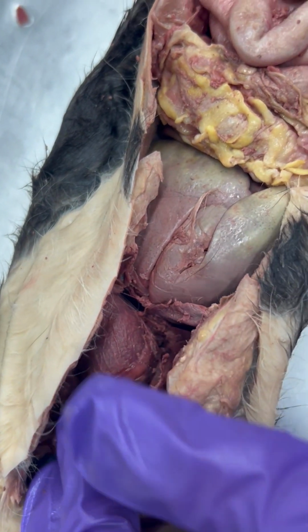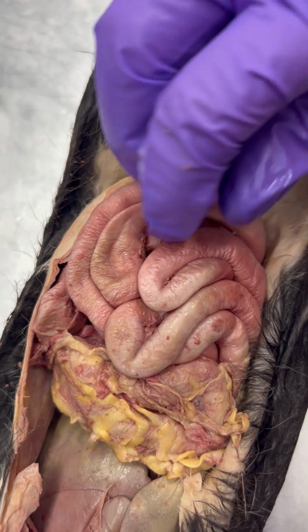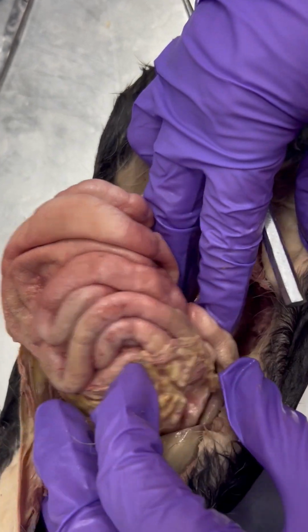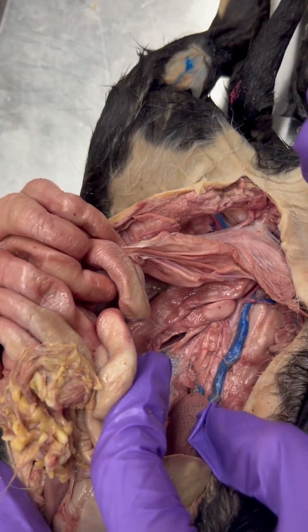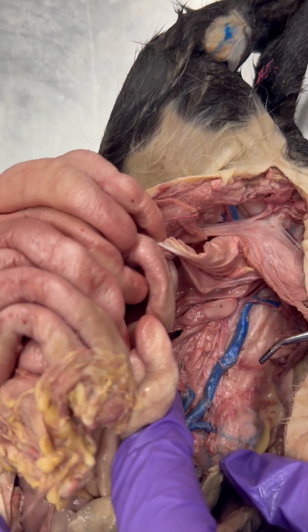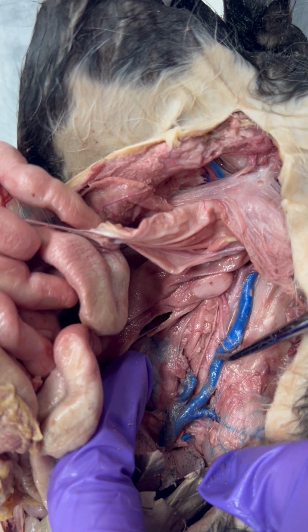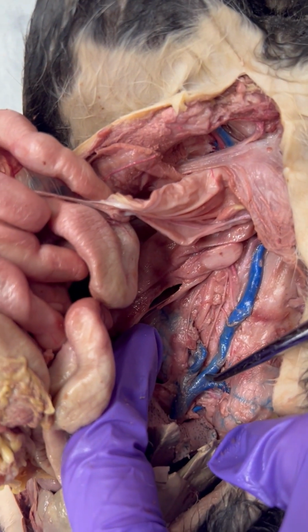So then moving on to figure 8.17, which in your lab manual is page 171, we have 3 terms that we want you to know. And for this, we're gonna have to go into the abdomen of the cat. We're going to very gently move our GI organs to the side. And again, we'll go over those next week, so you'll get to learn a little bit more. But as we saw in the last figure, we saw the pre-cava. Here we have the post-cava, which is this thick blue line, since this is a big vein that brings blood back to the heart. So the post-cava.